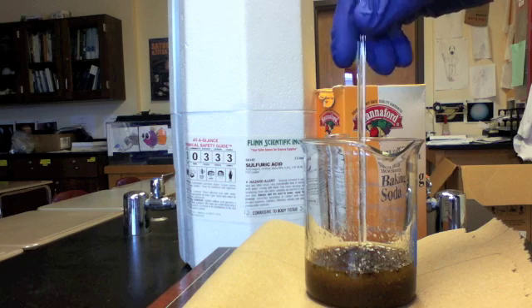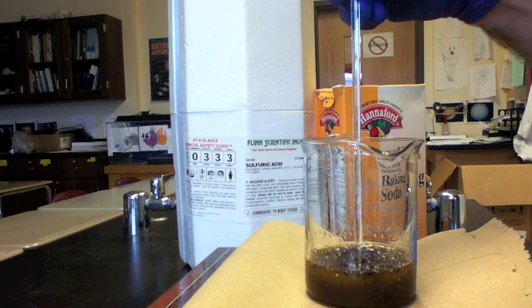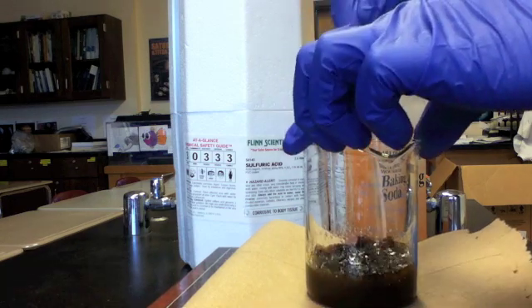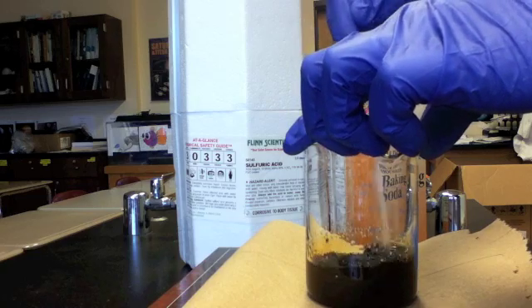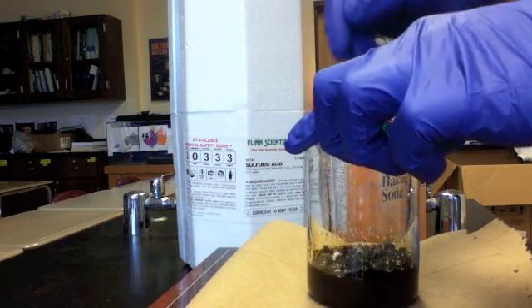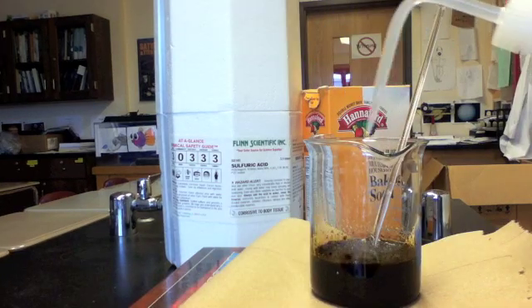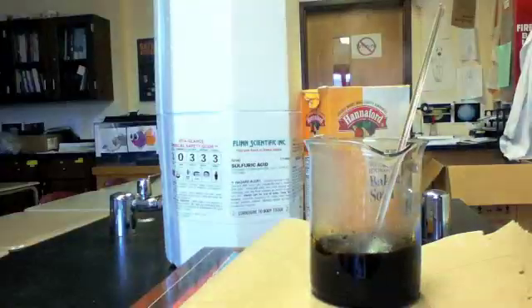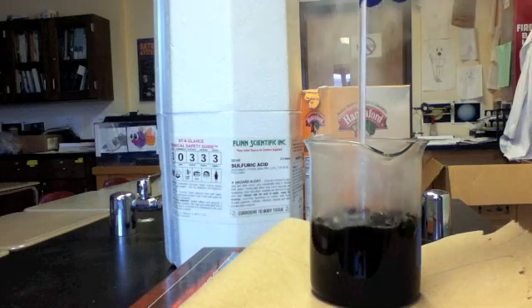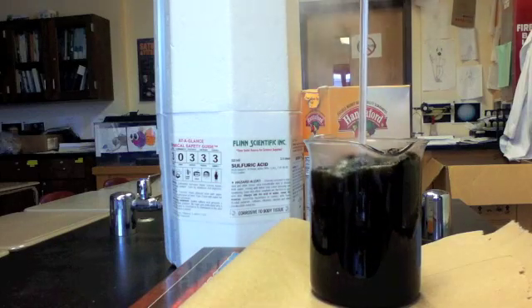The water, when it touches the sulfuric acid, causes an exothermic reaction of its own. When sulfuric acid is diluted with water, it releases an enormous amount of heat. This is enough to get the reaction going, in which the sugar becomes fully dehydrated by the sulfuric acid.